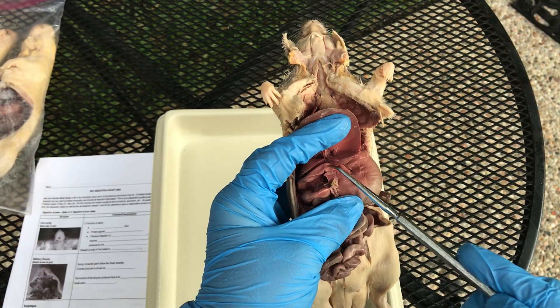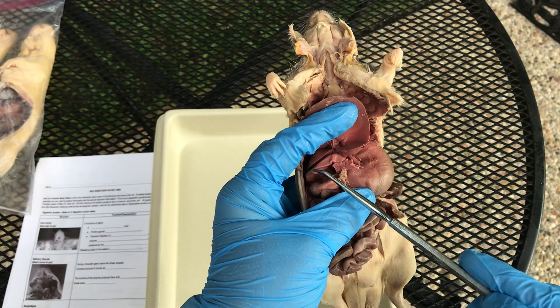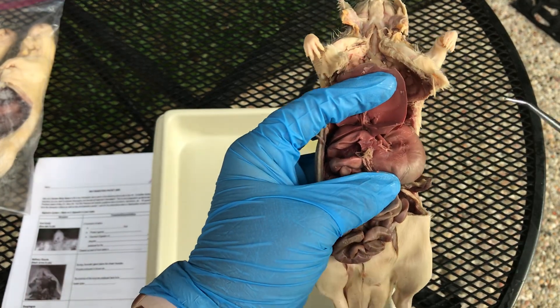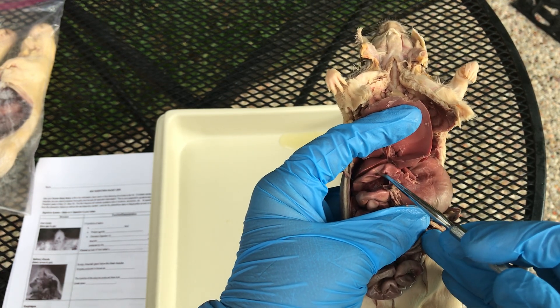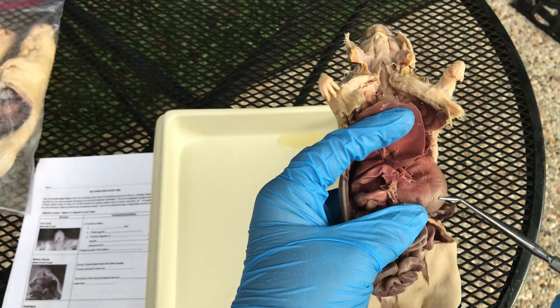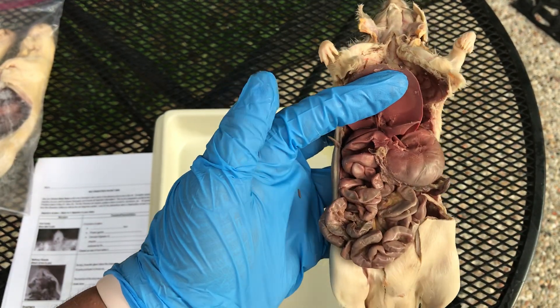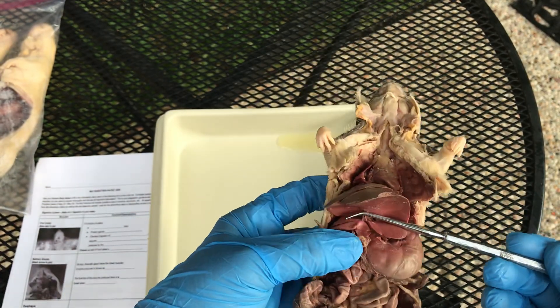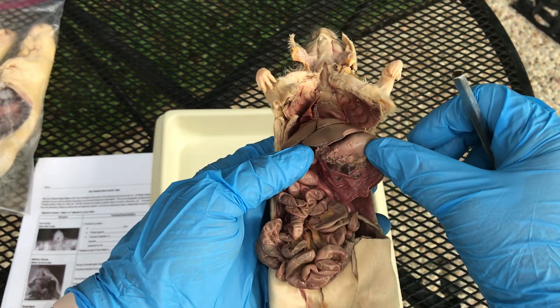Next, the food proceeds to the duodenum — it's right here, the first part of the small intestine coming off the stomach. A lot happens in the duodenum; the key phrase is that most enzymatic hydrolysis occurs here, meaning a lot of chemical breakdown using water to break things into smaller forms. The first thing that comes into the duodenum involves the pancreas, which is an accessory structure.